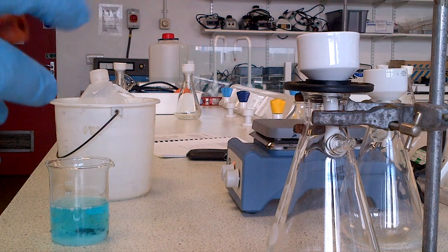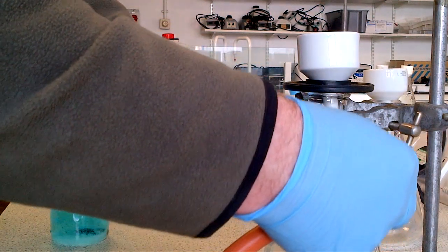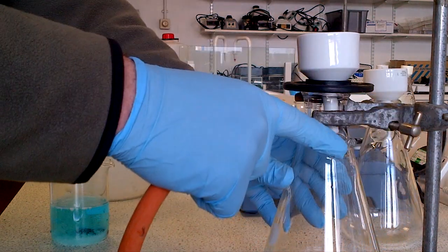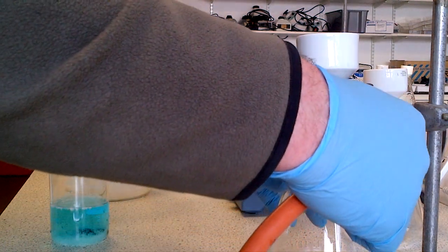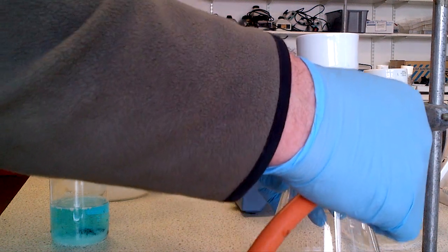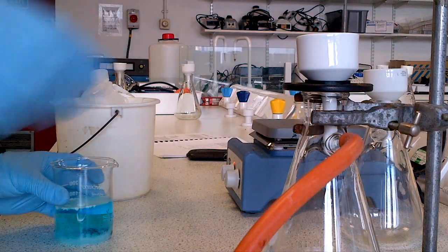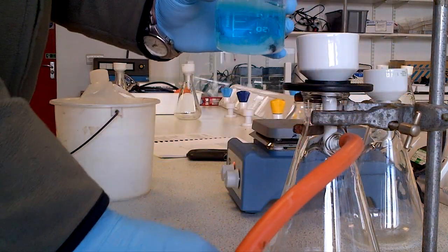You apply the vacuum tubing towards the edge of the funnel, and then the piece of vacuum tubing goes onto the lip part of the flask with a twist and a push so it's nice and secure.